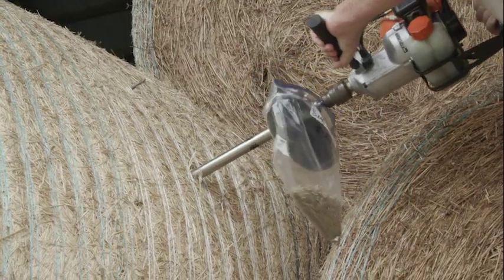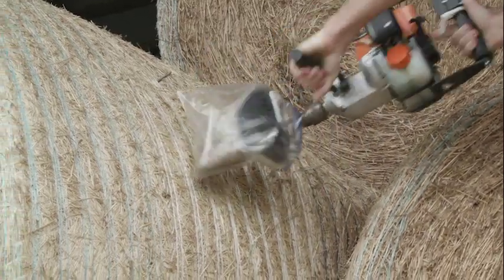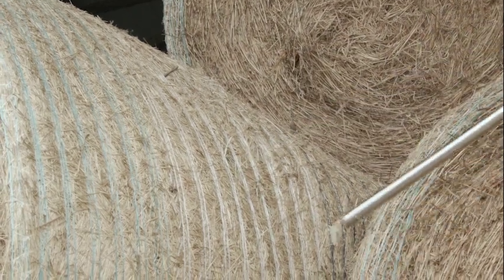The second important thing is that we get a good sample, and we do that by using a coring tool. We don't want to just pull a piece of hay out of a bale and send it in for analysis — we want to take a bale core. When we sample a lot, we'd like to get somewhere between 15 and 20 cores per hay lot, then composite those samples together, mix them up, and send the whole sample in for analysis.